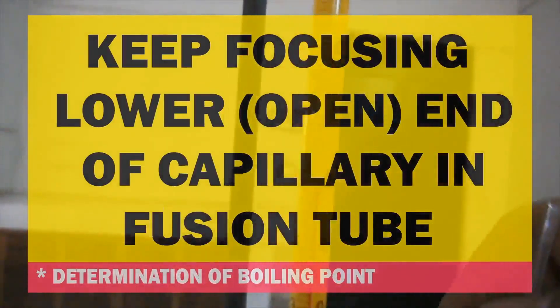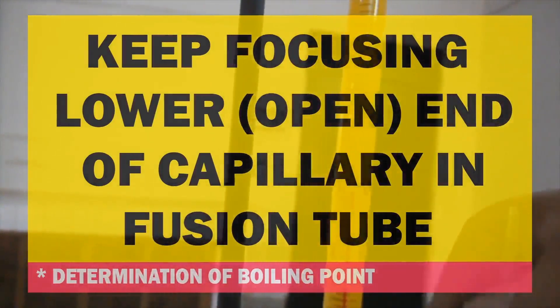Keep focusing the lower end of capillary tube present inside the fusion tube.